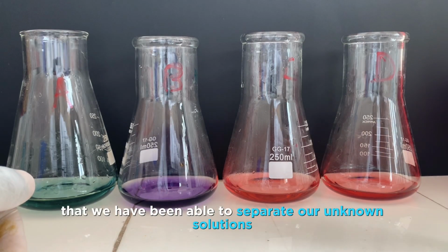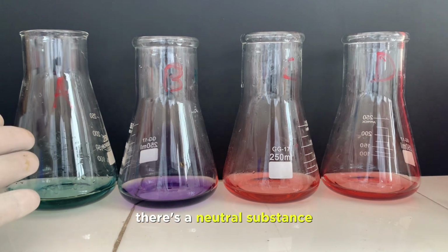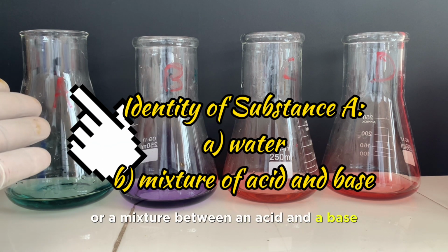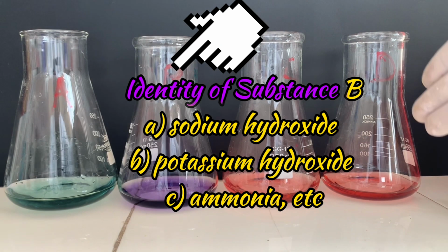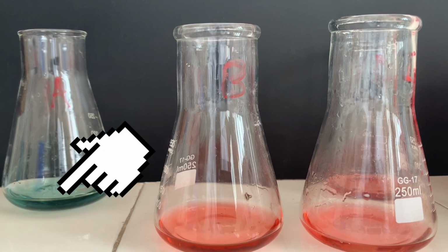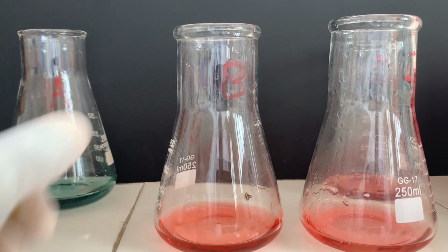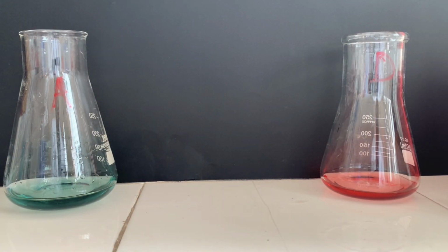Okay, so we've been able to identify the 4 different substances using our indicator solution. The first one could be water, perhaps, since it's neutral, or a mixture between an acid and a base. This one is obviously a base, maybe sodium hydroxide or something. The other ones are acids, maybe like vinegar or acetic acid or any other acid which you may know. Alright, take note, of course, again that since these tests are qualitative, you only need to add a few drops.